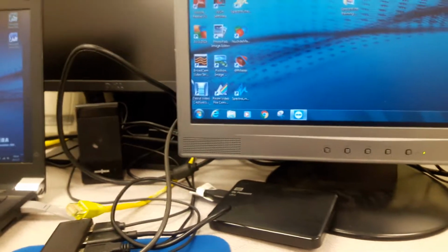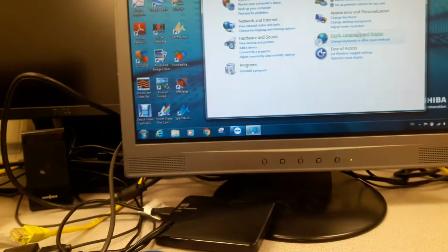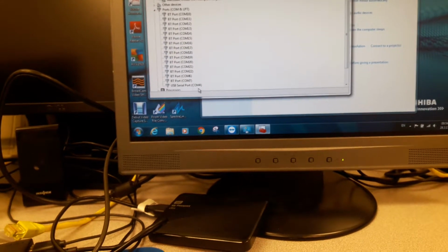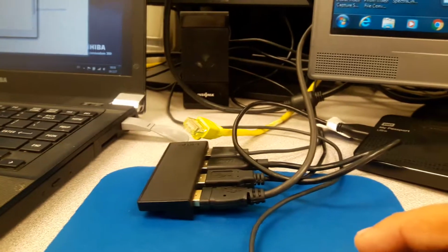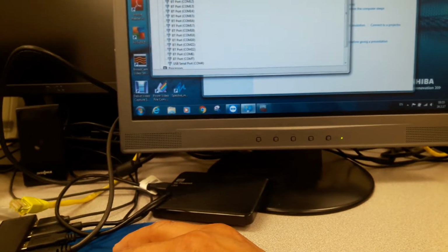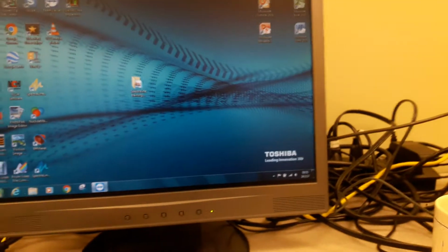And what happens when it's in the off position? If you go to control panel, into hardware and sound, to the device manager, we will still see it because the COM is connected. So even if it's in the off position, unless you actually physically disconnect the MCA, you will still see an active connection in COM4. Okay, because there is some power in the MCA system, even though it's not in the on position. So now it's in the off position.